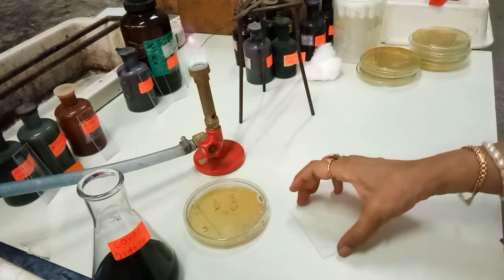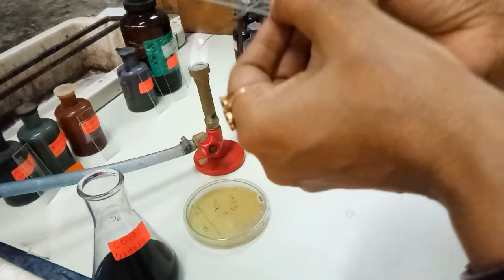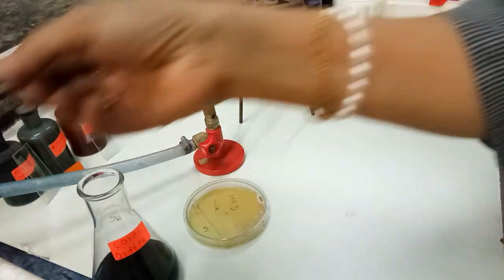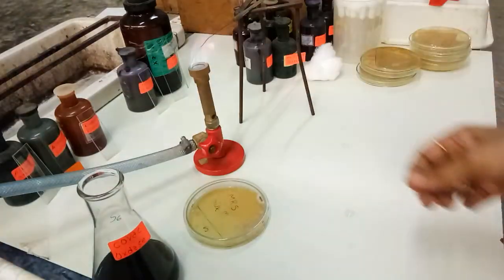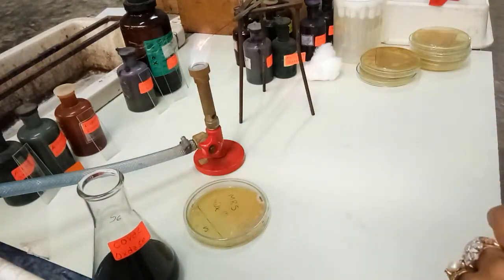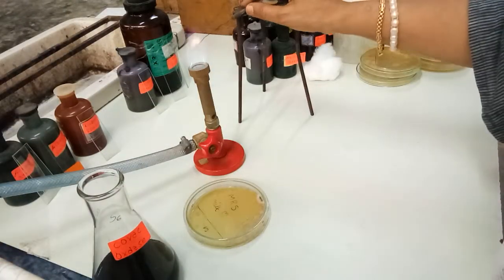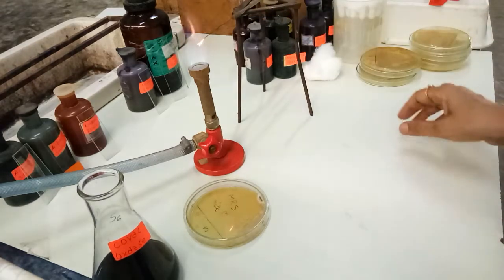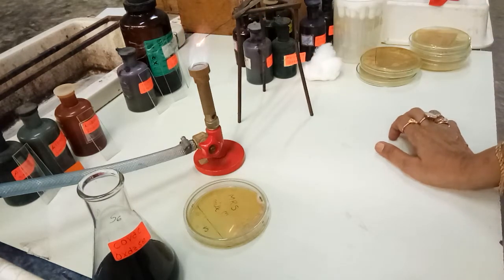The catalase test is negative, so we will keep this test aside. I am writing in my record book that catalase is negative in the case of Lactobacillus. Now I will go for making the suspension from my colony.